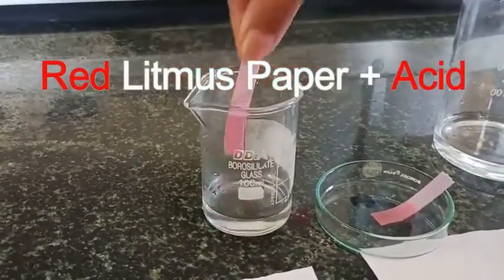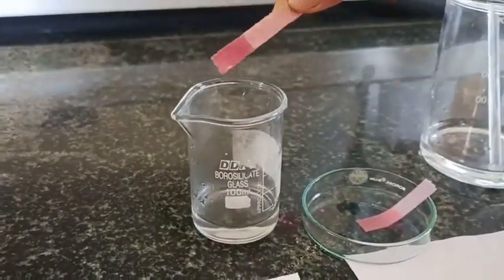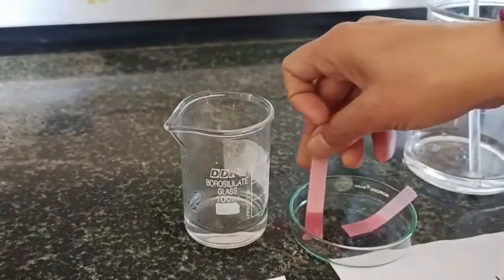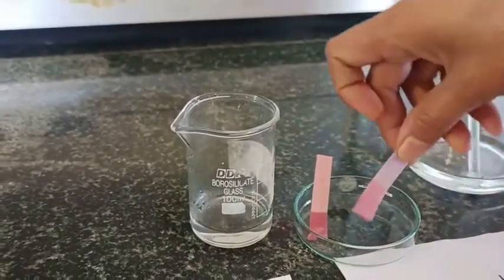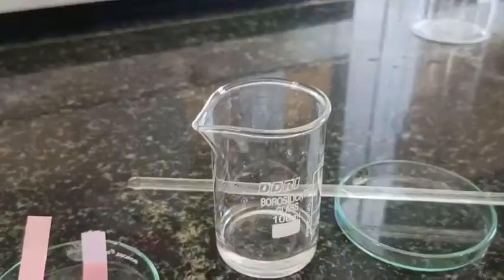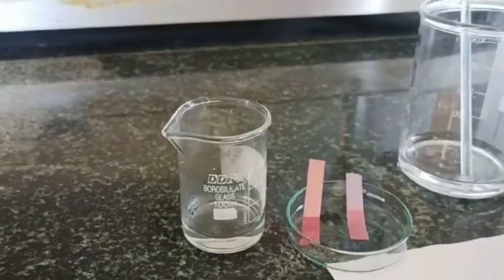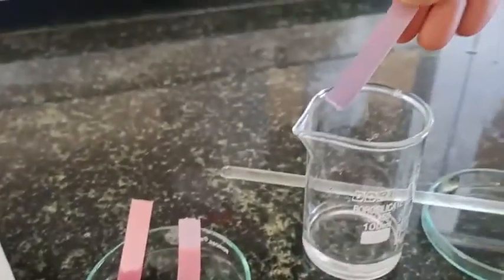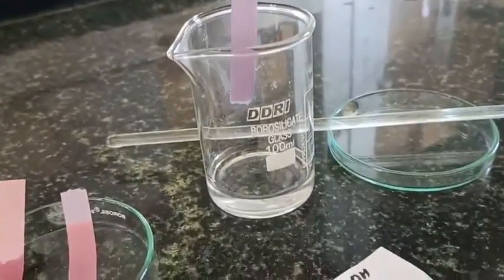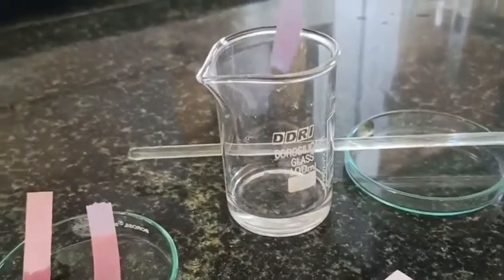The red litmus is dipped into concentrated HCl — it doesn't change color. It seems a little darker just because it is wet. We are having ammonia solution, so this is the litmus paper I am not dipping into it just yet.